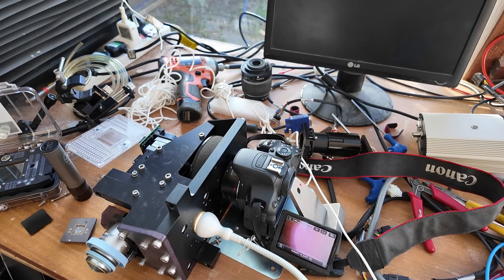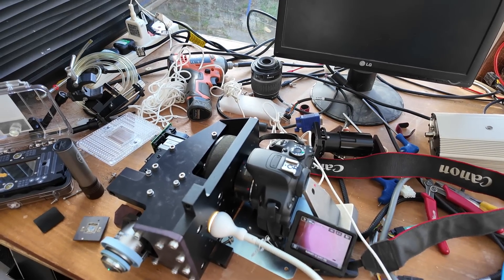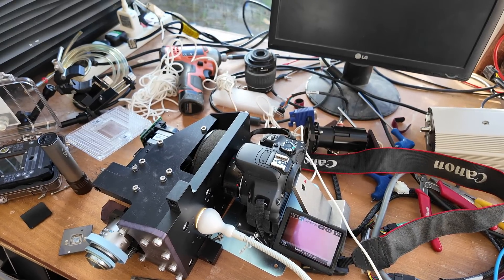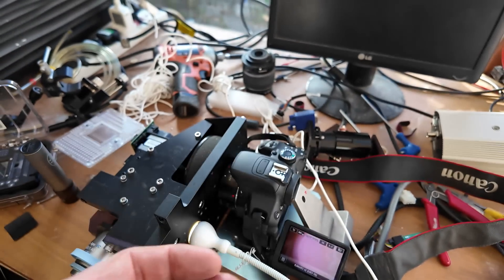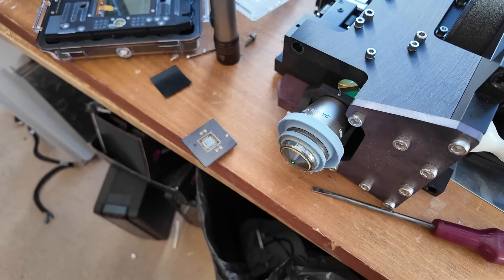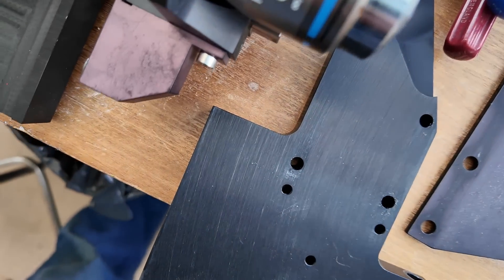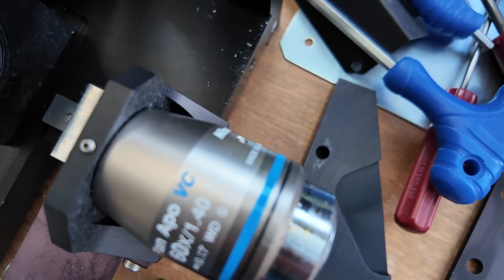I've had a try setting this up with my DSLR just to get some idea of the magnification. Without all the stage and adjustments it's quite a fiddle. Just trying to take a photo of a chip — the magnification, because it's only 60x, is not actually great. So I don't think there's any real benefit in trying to keep this as a working XY stage. The focus distance is extremely close, so probing chips you'd have to depackage them because of the shape of the lens. With the size and general hassle I don't think it's worth trying to preserve this as a useful thing. For any microscope aficionados this is actually an objective made by Nikon — no doubt very expensive, but being only 60x and needing oil it's possibly of limited interest. I will be sticking this on eBay in case anyone's interested.